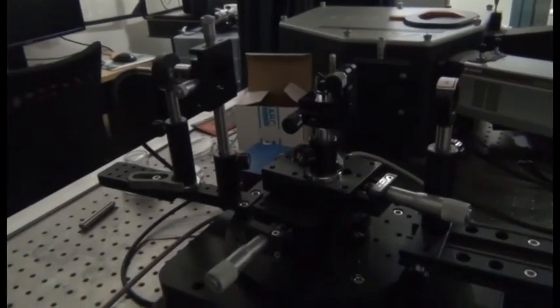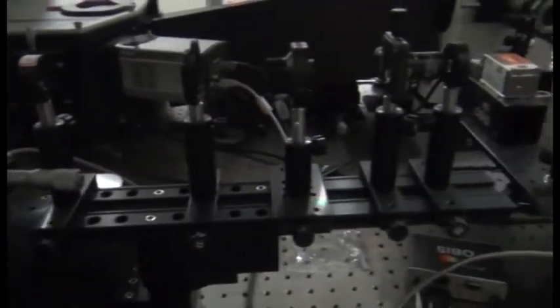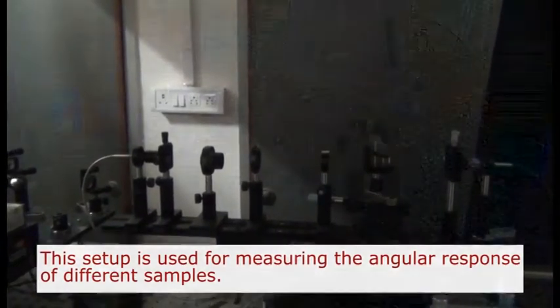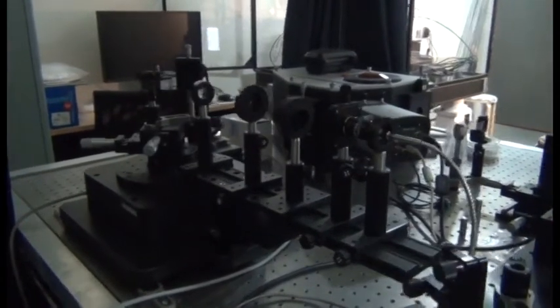We are currently studying the angular dispersion of surface plasmons, which can be excited on thin films. This kind of arrangement or excitation geometry is called a Kretschmann configuration. This again has two different parts, the excitation and the collection part.